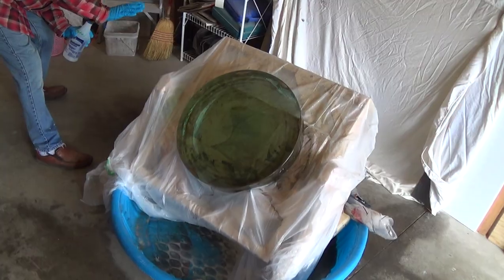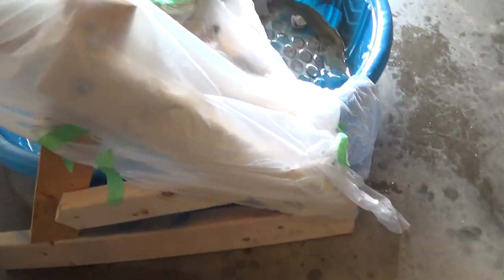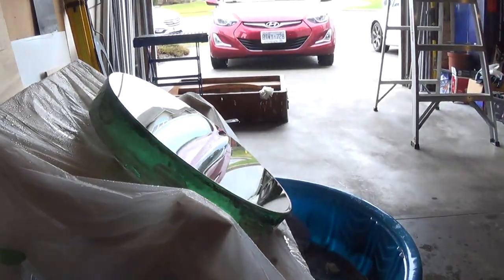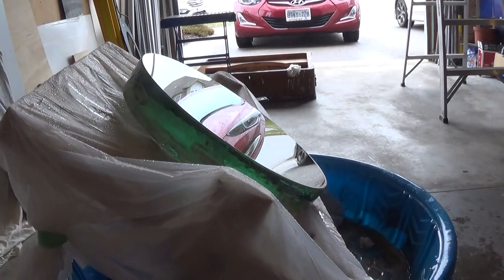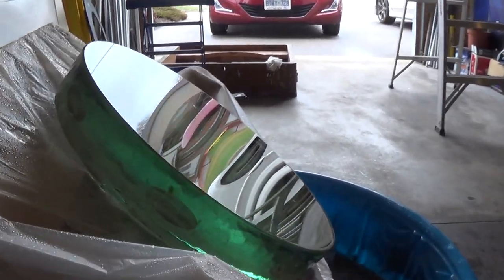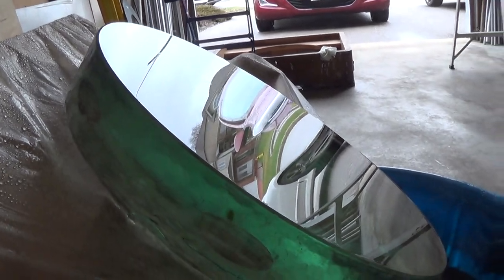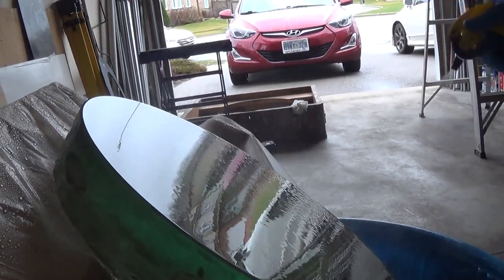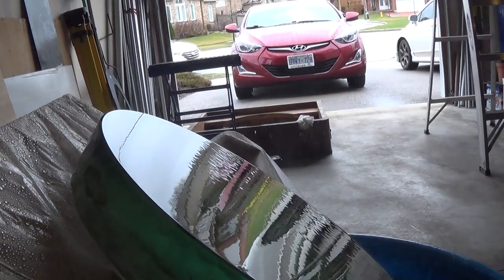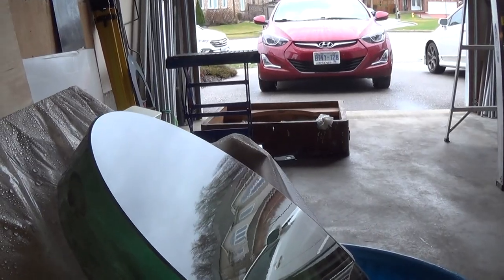I can come over here and take an image of the grazing angle on the glass. See how there's the wetting action — it's such that there's no water break. We can confirm there's no water break. You can move closer along the edge — you can see there's a lot of it. Very, very important. It's holding a film of water, which means that it's very clean.